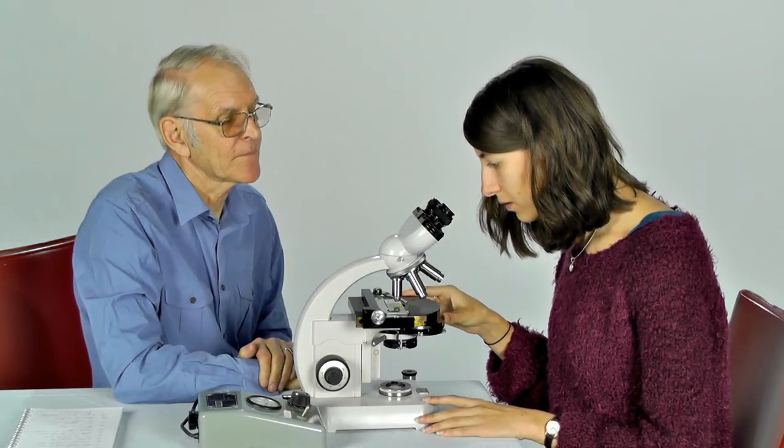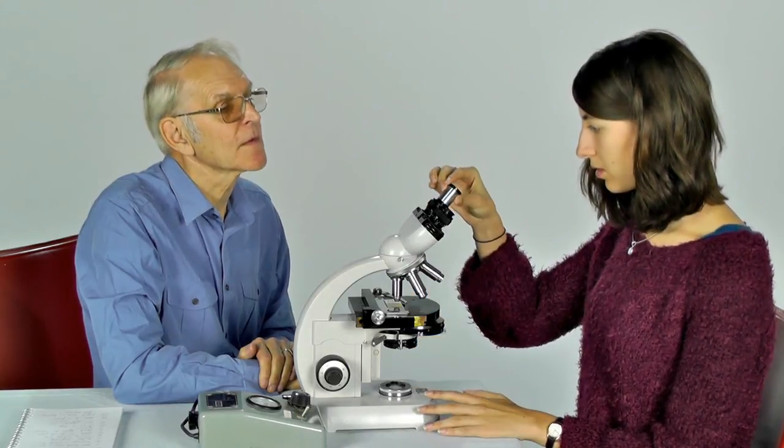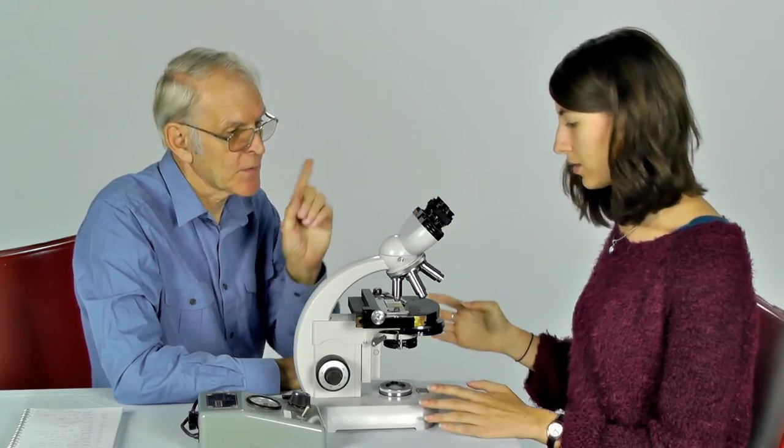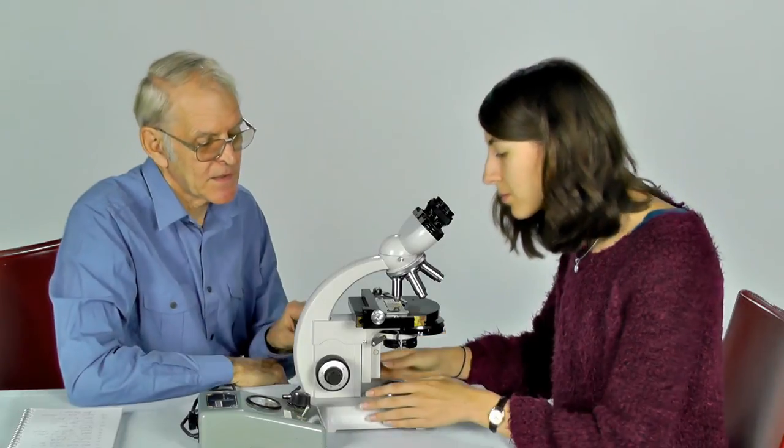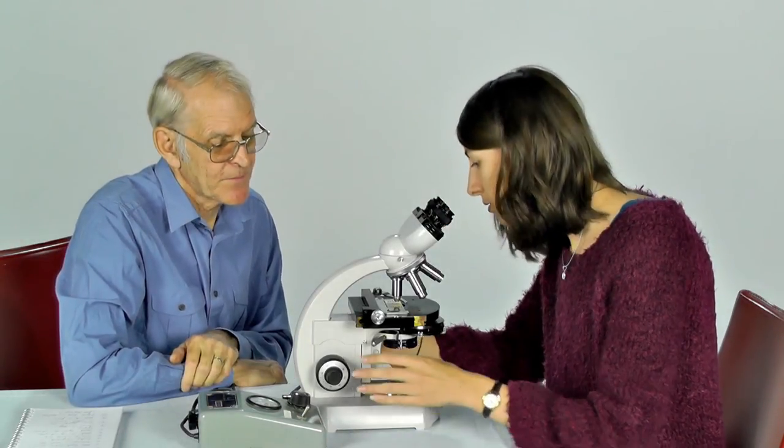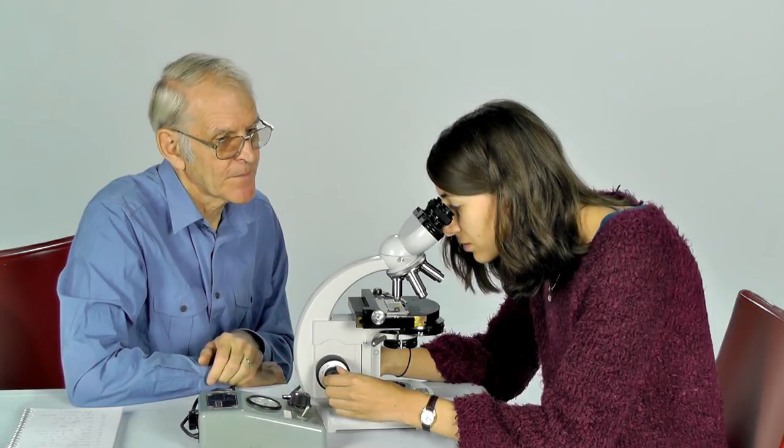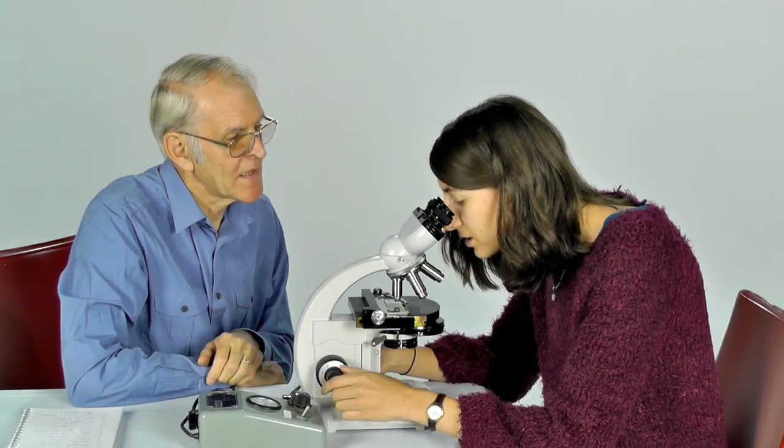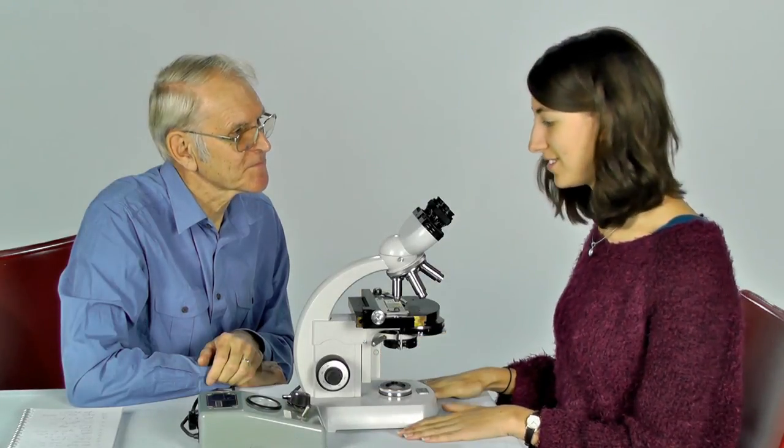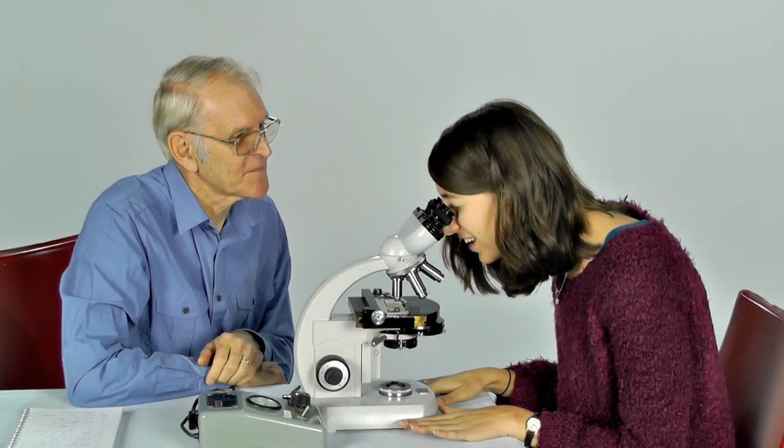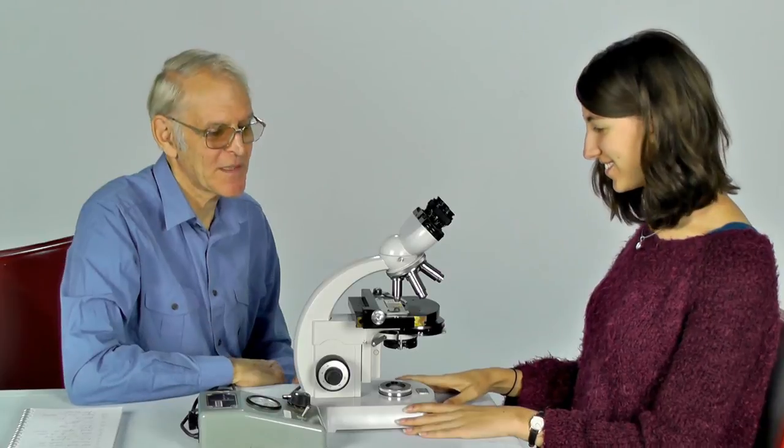Pop your eyepiece back. And now, look down your eyepieces again and use your fine adjustment to just ensure that you have a really crisp image, nice in focus. Are you pleased with that? I am. Yes. Well done.